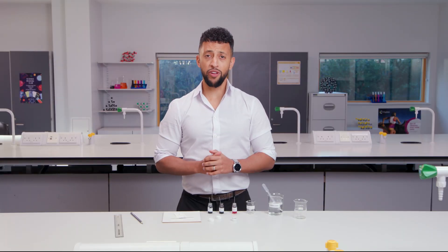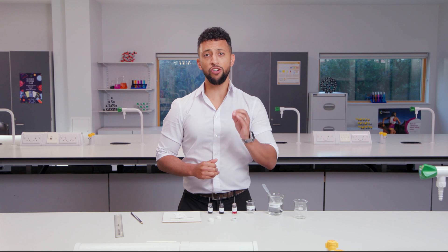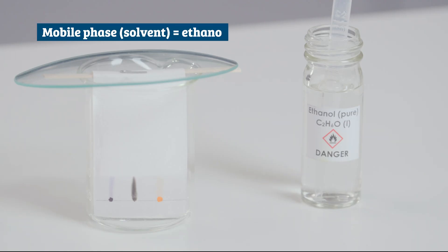You could repeat the experiment again with a different mobile phase to try to separate sample two. I used ethanol as the solvent instead of water on the same three samples.